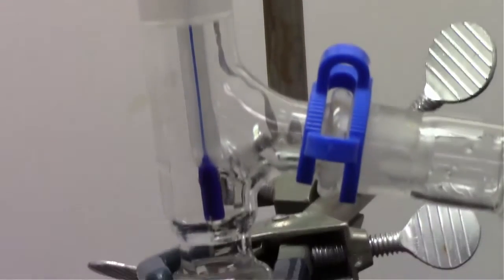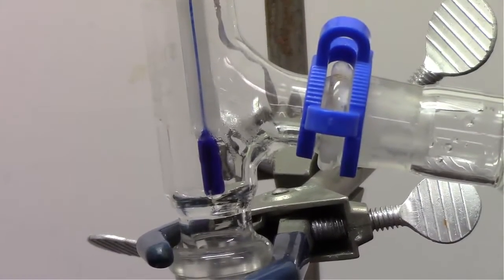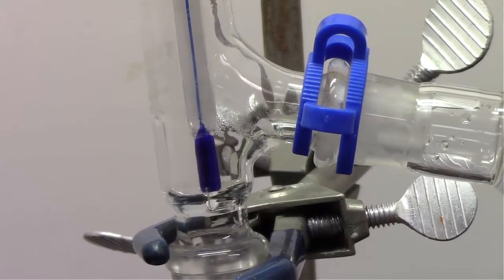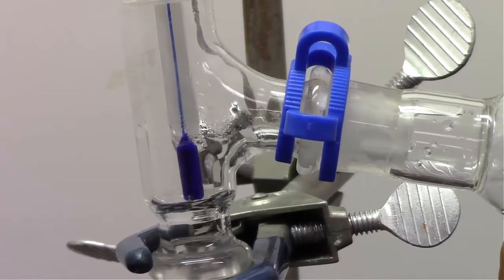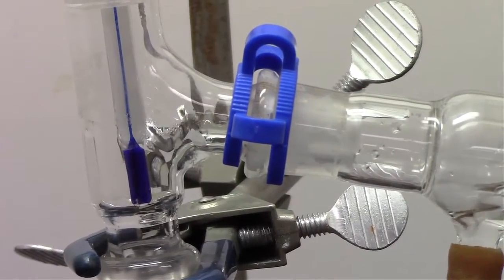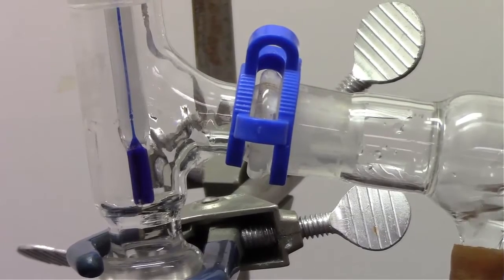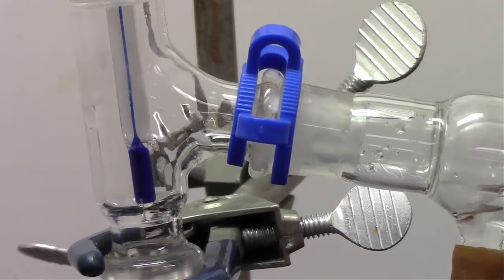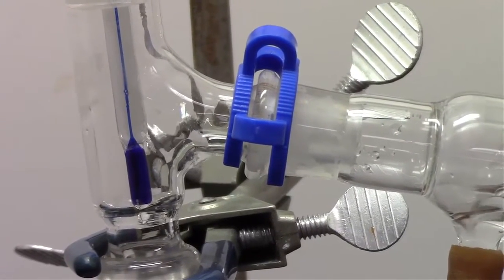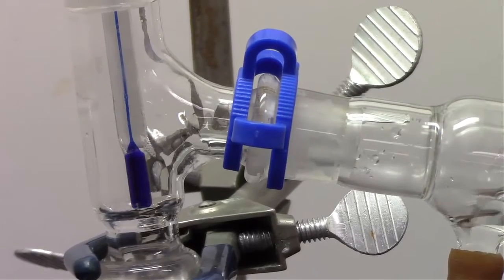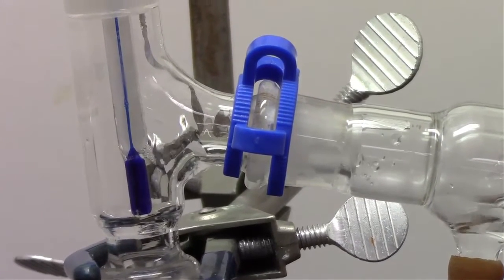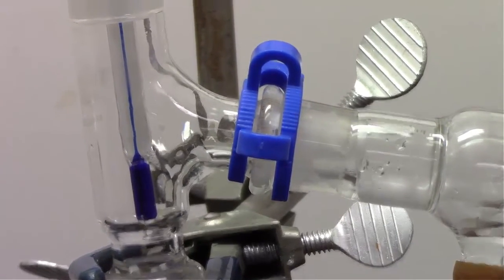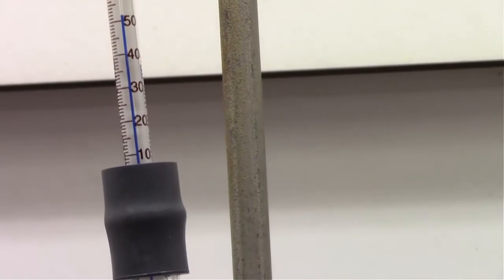Now it looks like the temperature is starting to rise, which means that area of evaporation and condensation is around the thermometer, and now it looks like our condensation is happening on the portion of the three-way adapter connected to the condenser. So condensation is happening in the condenser, and once that happens, that liquid will start to be collected.